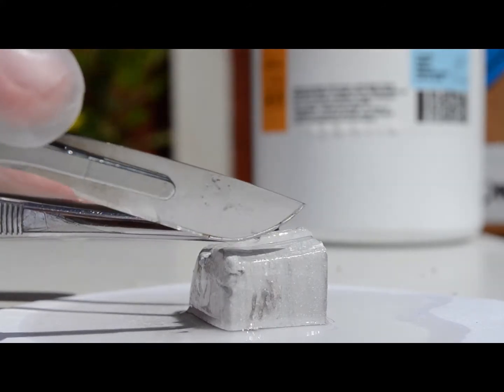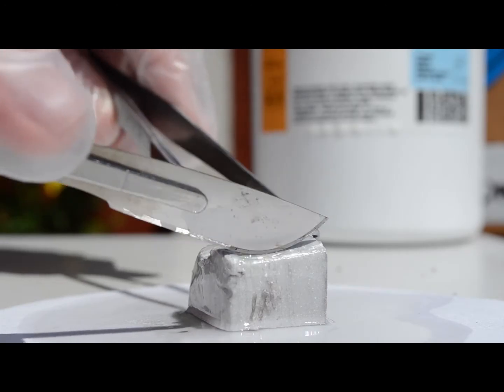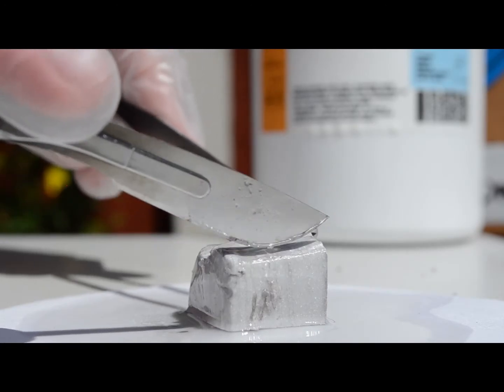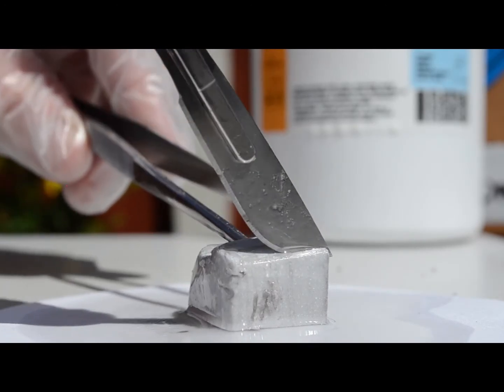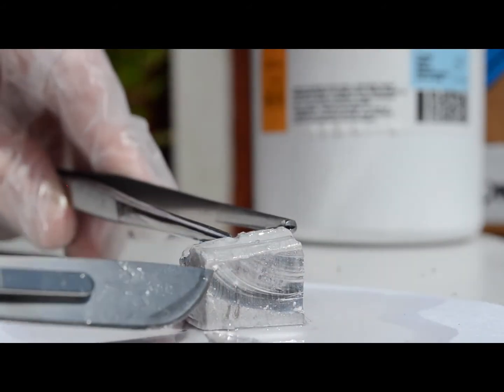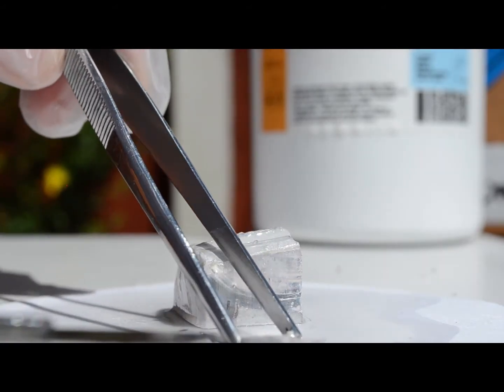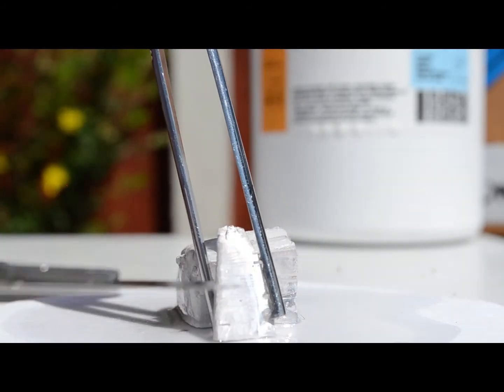Now I'm going to cut a piece of sodium off. This is about 5 grams that I have here - quite a lot. I'm just going to cut in. You can see it can be cut with a knife. There we go. We can see it's a really shiny surface there, and also in this piece, a shiny bit.